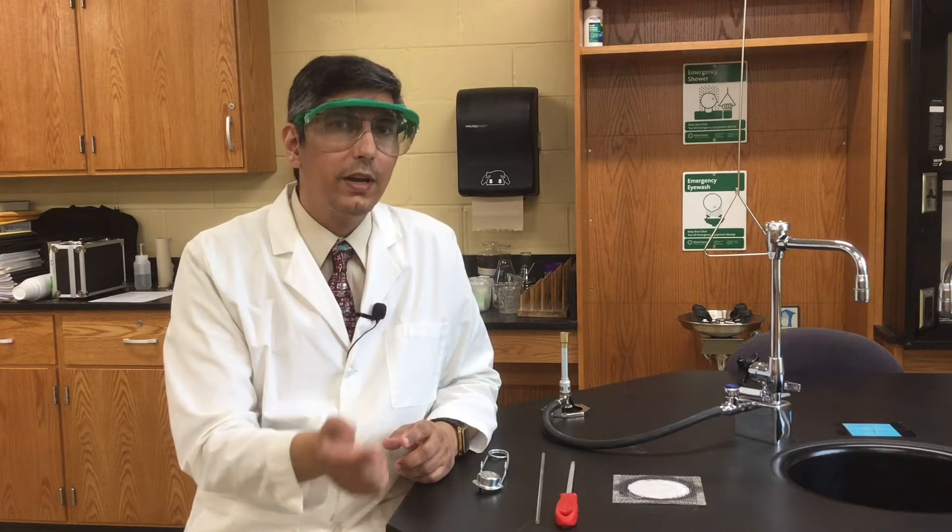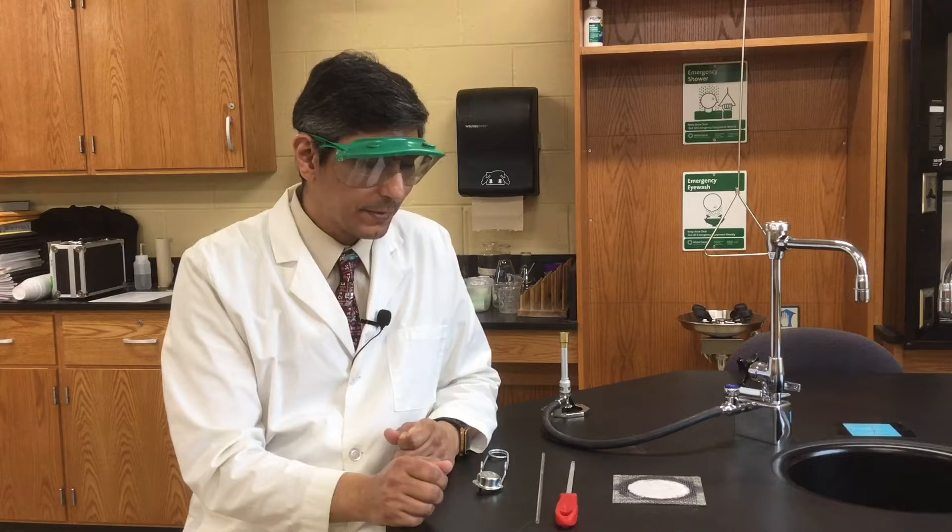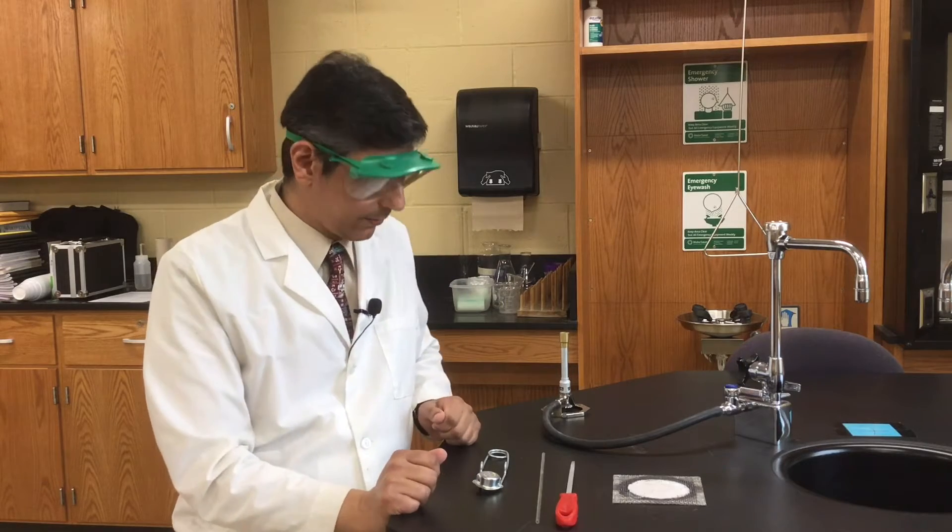Now if you don't know how to use a Bunsen burner, watch my other video on how to use a Bunsen burner in order to get acquainted with that. Now let me show you how we're going to cut the glass first.